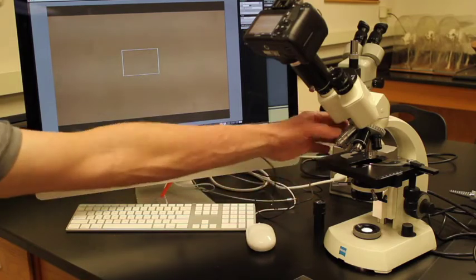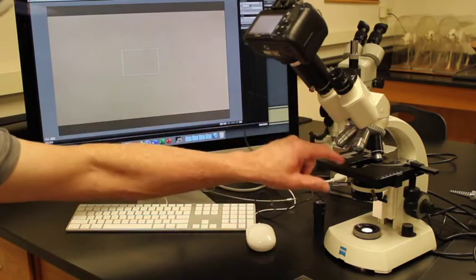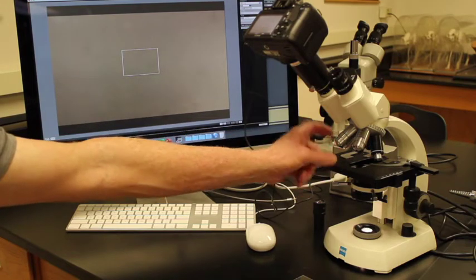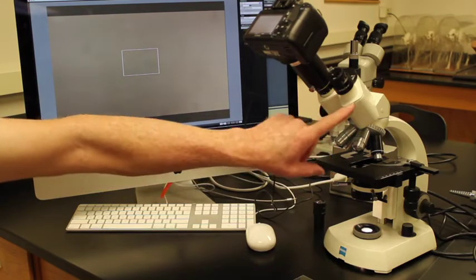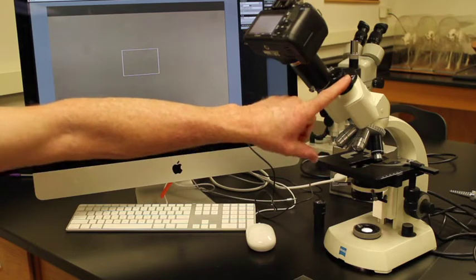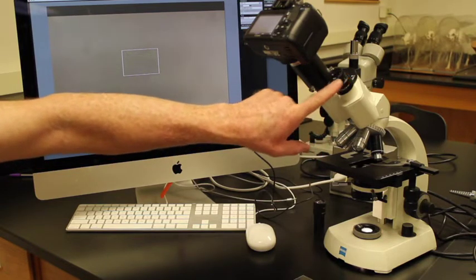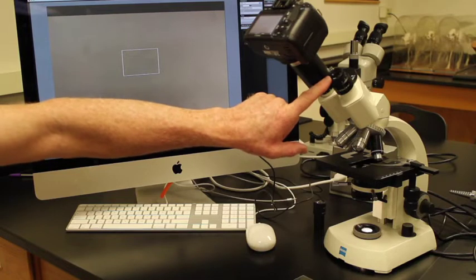It's transmitted up into one of these structures which are called objectives. It then goes through this tube, bounces off a mirror, hits the ocular and it's magnified again by this lens which is a 10x ocular.